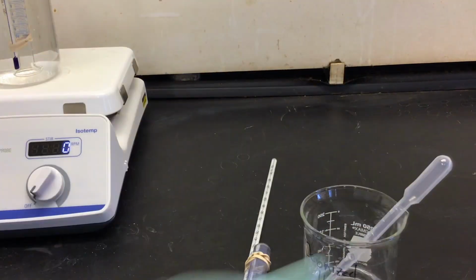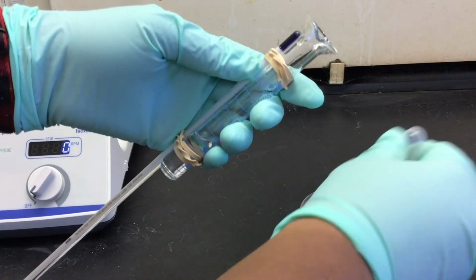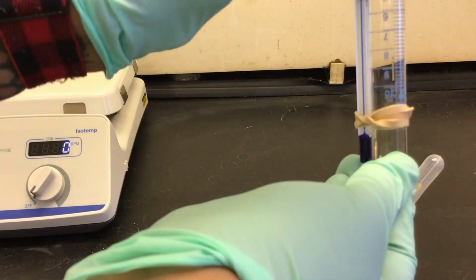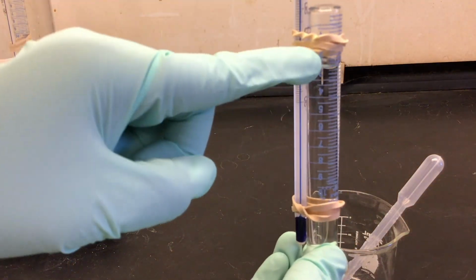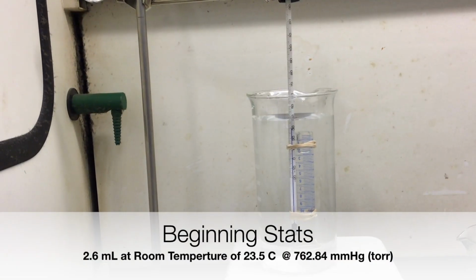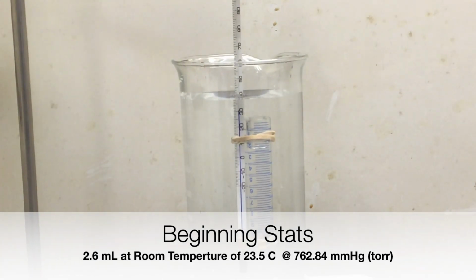Next, we're going to add enough deionized water so that when we invert the graduated cylinder, we'll have an air bubble at the top of the graduated cylinder that's only a few milliliters. Also, we make sure we record the room's temperature and current atmospheric pressure during our experiment.